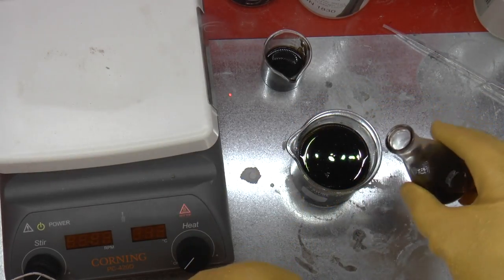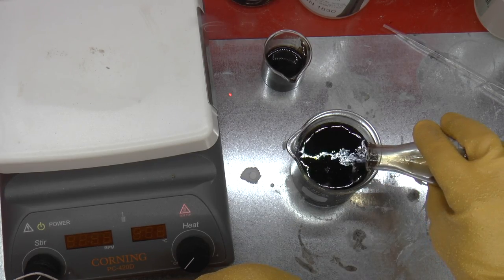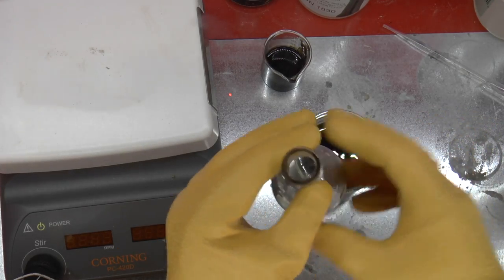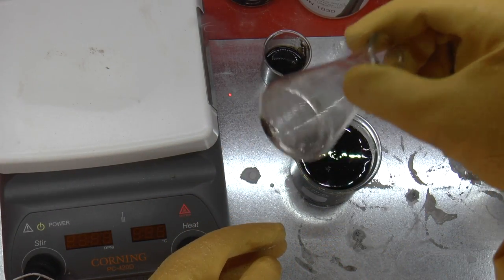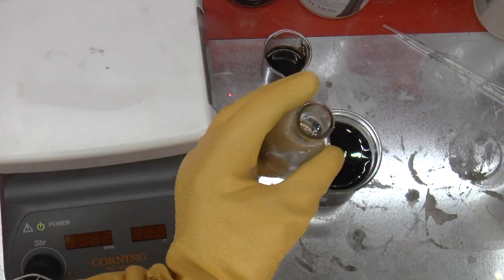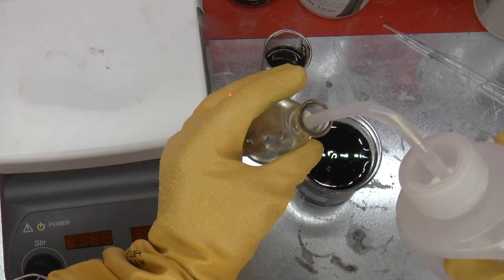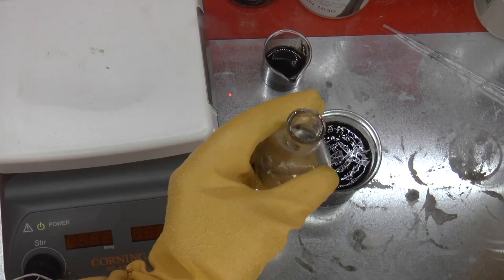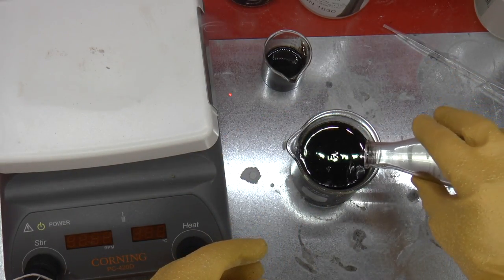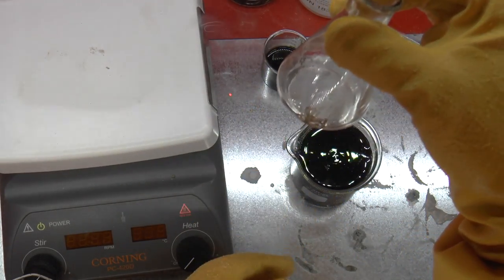The water acid mixture is still pretty dirty because there's a lot of carbon. I've got this other beaker with watery acid in it, so I can distill that off as well later on. But I'm basically pouring off the dirty water very carefully. Now we can actually see that we've got a bunch of dregs which consists of the pins, the lead frame, and the die. That's pretty good. Let's give it another wash because the next step is actually going to be taking this and just washing off the die with some acetone.